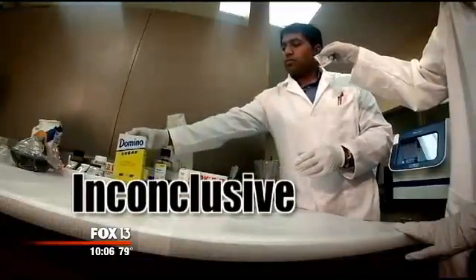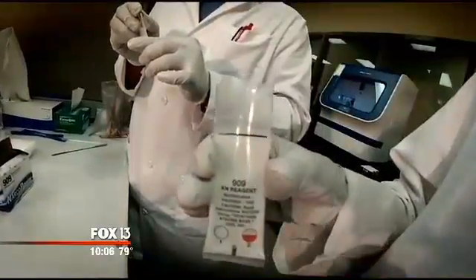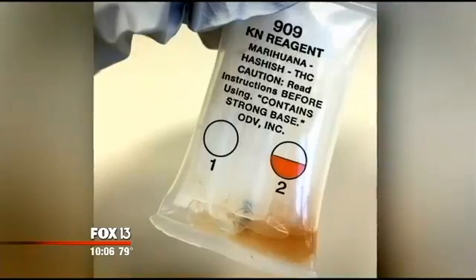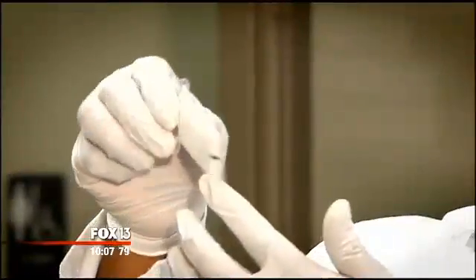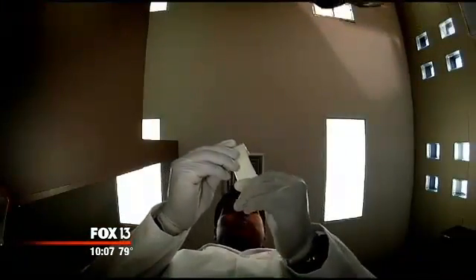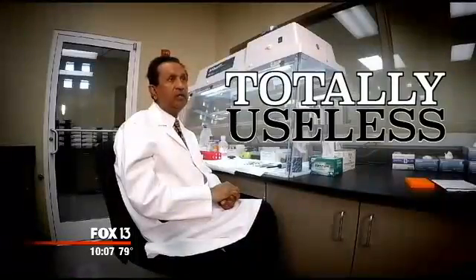The sugar test was inconclusive, but watch how the Narco Pouch test kit shows something from nothing. Opening the pouch and exposing it to air. You heard right, nothing but air. Again, watch what happens. This could be interpreted as a potential positive for marijuana, when in fact it's just air. This shows us right here how unreliable these tests are. Now, one last test. In this case, we're not gonna open the pouch at all. Maybe the most compelling. They're both clear. There's no color in there presently. The Narco Pouch test kit was never opened. There's nothing in it. Yet. Indicating that a material is marijuana when in fact it's not. There's no substance in there at all, and yet it turned orange. Most of the time, they are just false positives. I think they're totally useless.